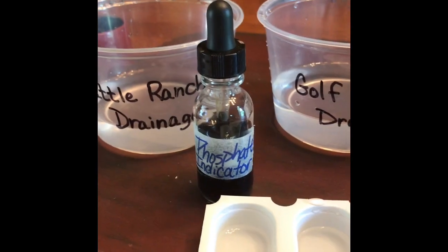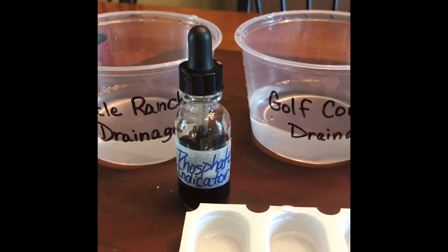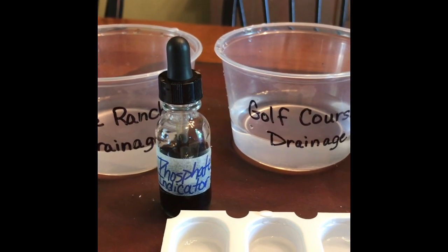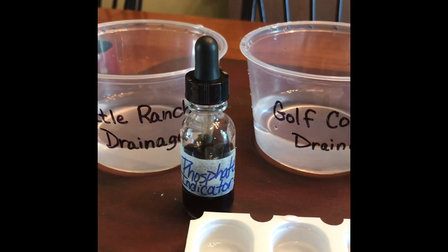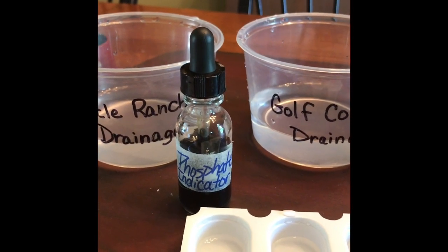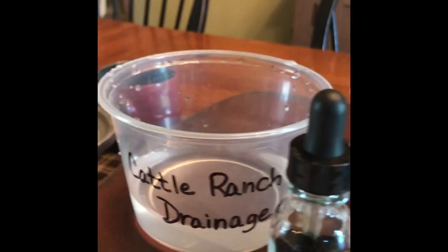If the phosphate level is too high in the water samples, then the color of the water is going to turn yellow with our phosphate indicator. If the phosphate level in the water is okay for the fish, then the water sample is going to turn a blue or a green. So we're going to test the phosphate levels in each of the water samples that we have, and you can find your data sheet in your case files day 20. We're going to start in order as it's listed in your data sheet with the cattle ranch drainage.